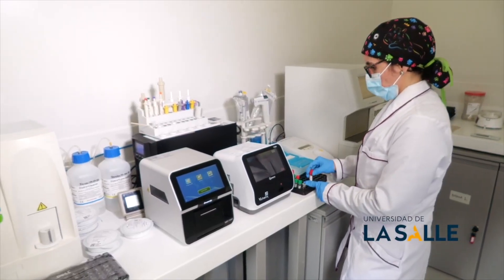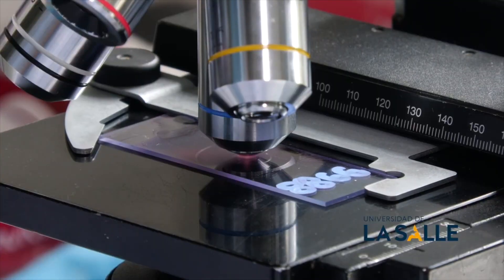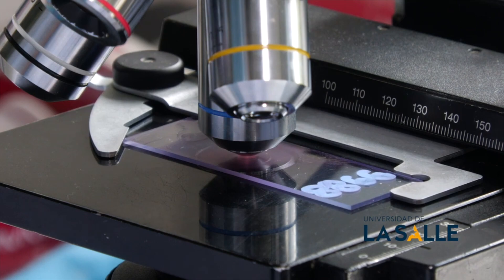Biosafety is very important in the laboratory, especially because some diseases are zoonotic. It is vital to generate confidence in the people who are part of the laboratory. So it is essential to use a cap, mask, gloves and gown, and if possible, use a change of shoes. It is also essential to control any cross-contamination.